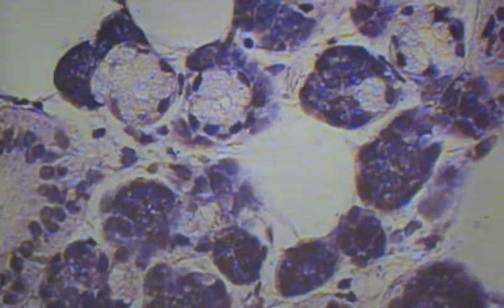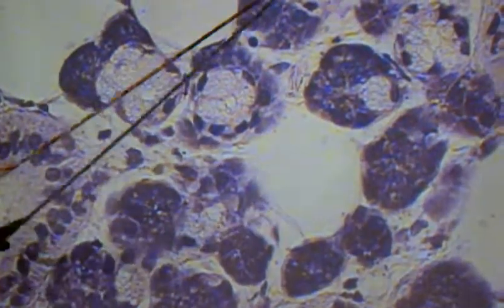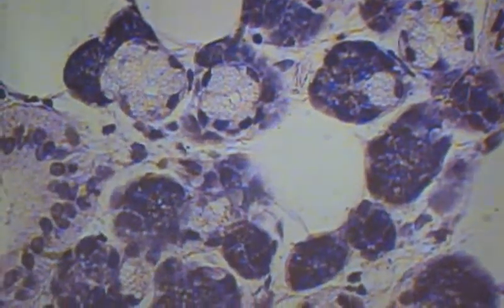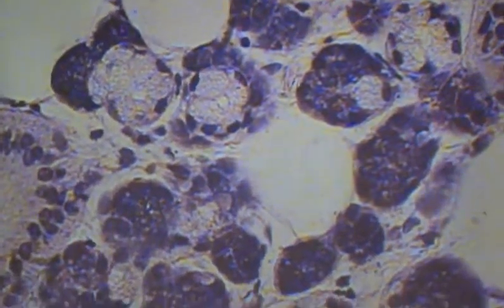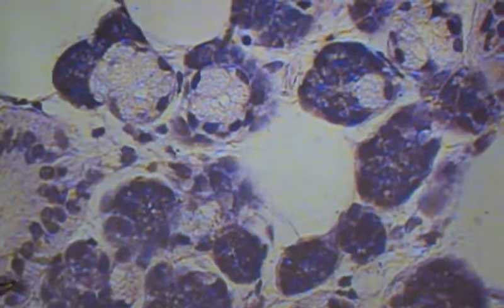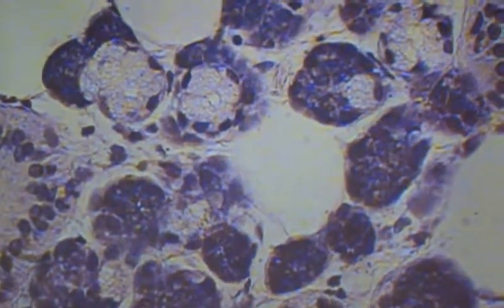So first of all, adipose cell — adipose, right? This is duct, although it's not a good view of duct. I can tell by that tall epithelium. There's some debris in this lumen right here.